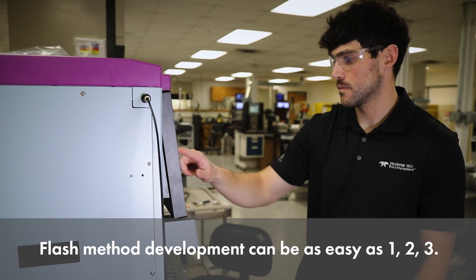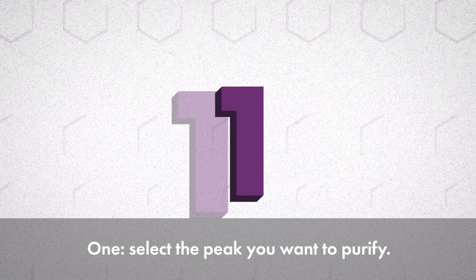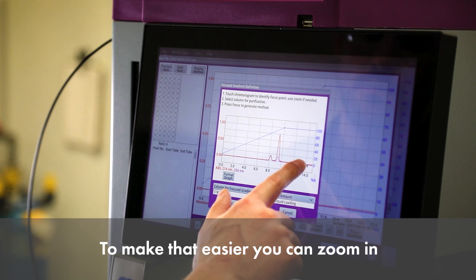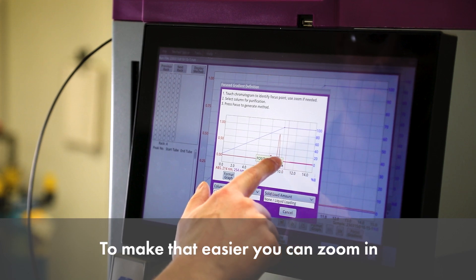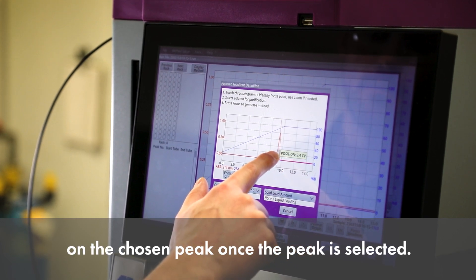Flash method development can be as easy as 1, 2, 3. Step 1: Select the peak you want to purify. To make that easier, you can zoom in on the chosen peak once the peak is selected.